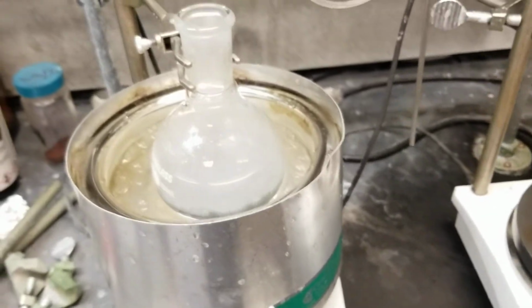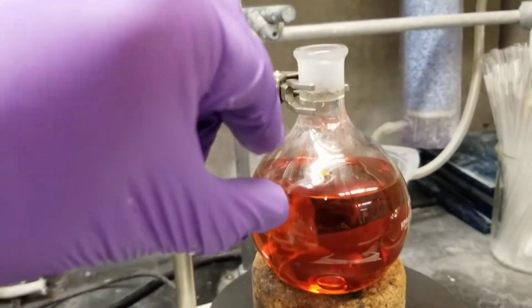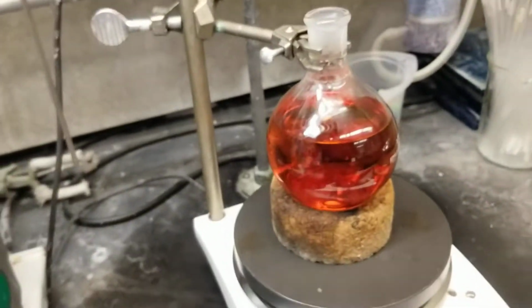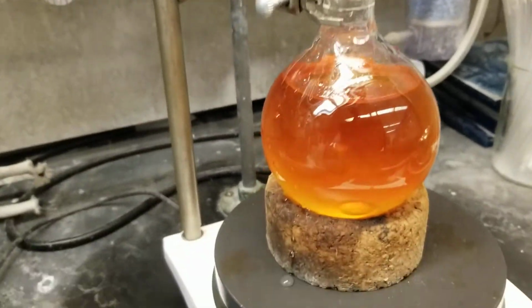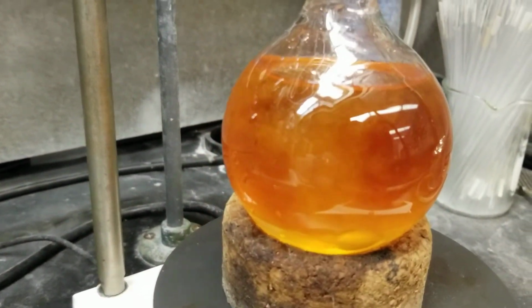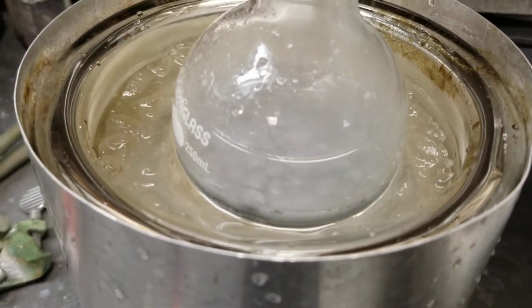Conversely, I have this material here in this reaction, and this is actually not ideal because as you can see, I have less than 50% of headspace available to allow for any expansion or contraction of the materials in there. However, this reaction I'm fairly familiar with, and I don't expect to have any troubles as I'm dealing with it. And so you can see in this case I had no real visible bubbles as compared to this one. So let's slow it down, take a closer look.